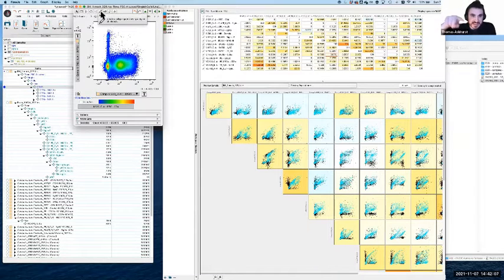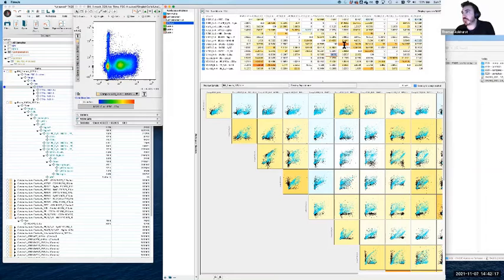So for each pair of fluorophore detector sets, we have a place in this matrix and a value which is applied. Now, the astute of you will see that actually a couple of these values are above 100. I just want to make a very quick point about that: that number actually doesn't have to be as scary as it sounds. The number, as we discussed, is simply a ratio from the primary detector to the secondary detector for that particular fluorophore. In most panels, you shouldn't be expecting to see compensation values of 100 or above. It depends on the exact fluorophores you're using, how much overlap they have, the individual detector settings. But for reasons we don't necessarily have the time to get into, you can have compensation values of 100 or above, and that can be totally okay.